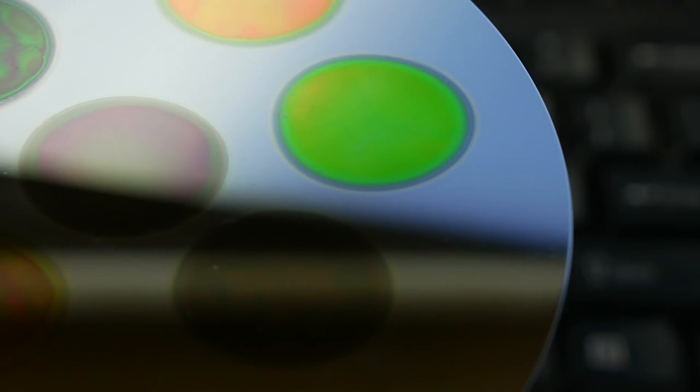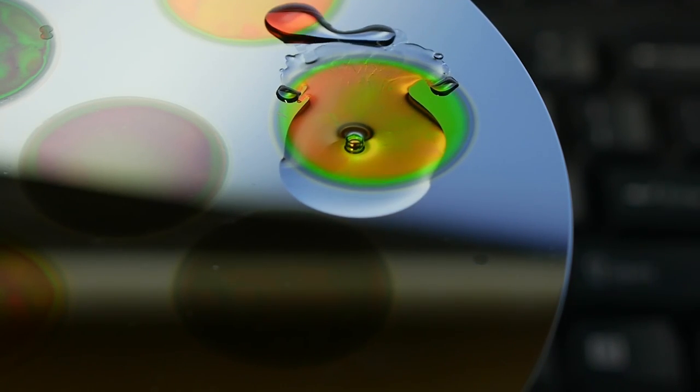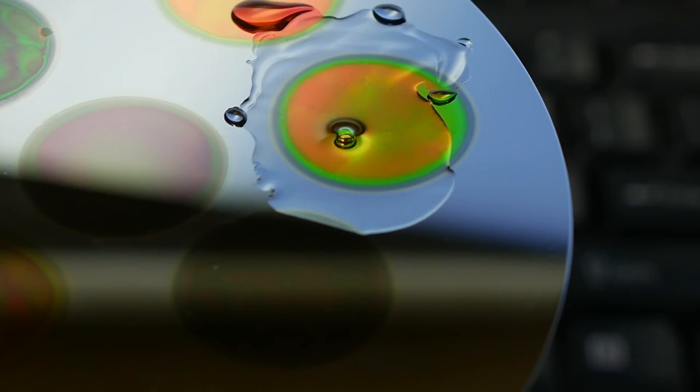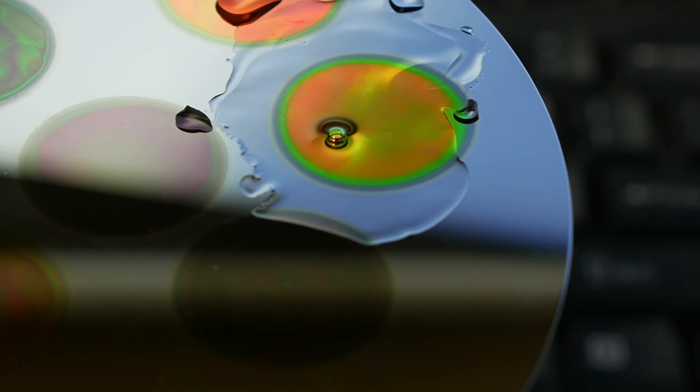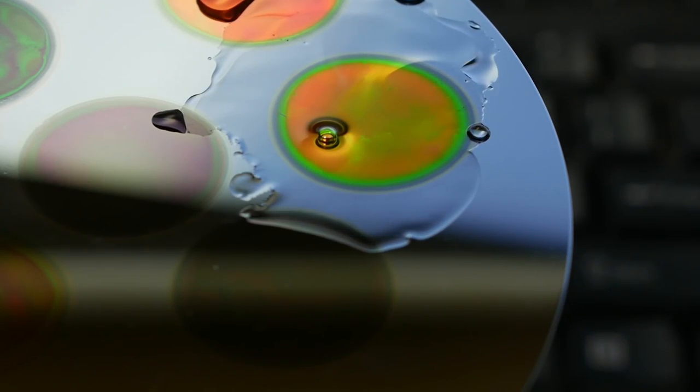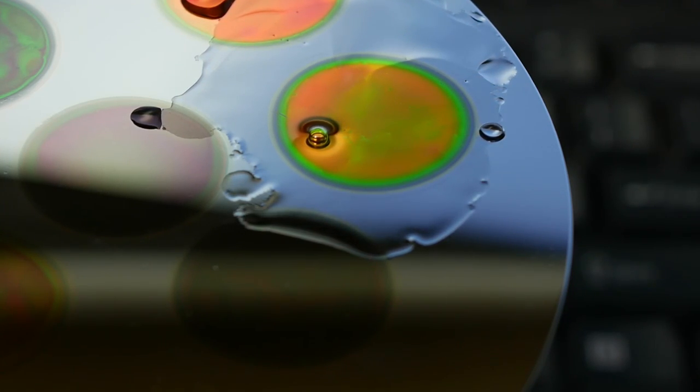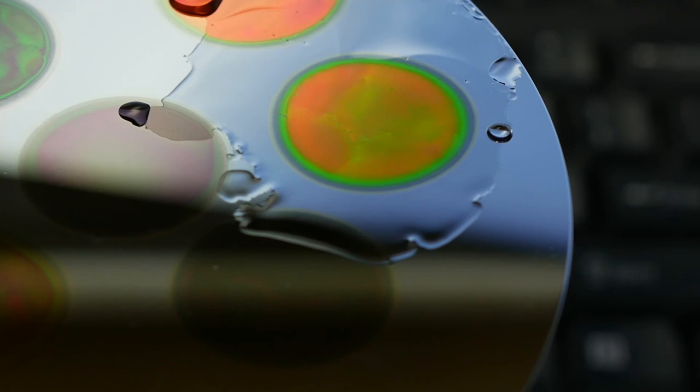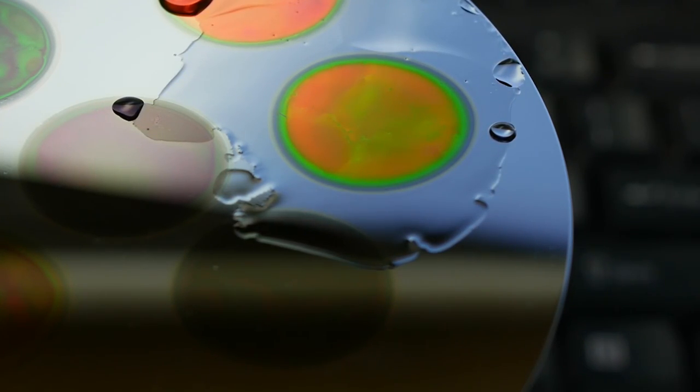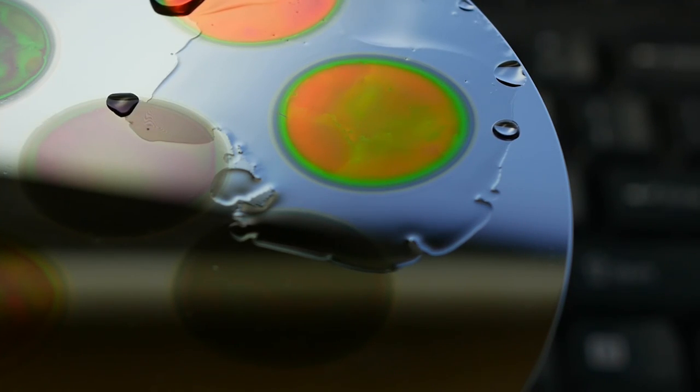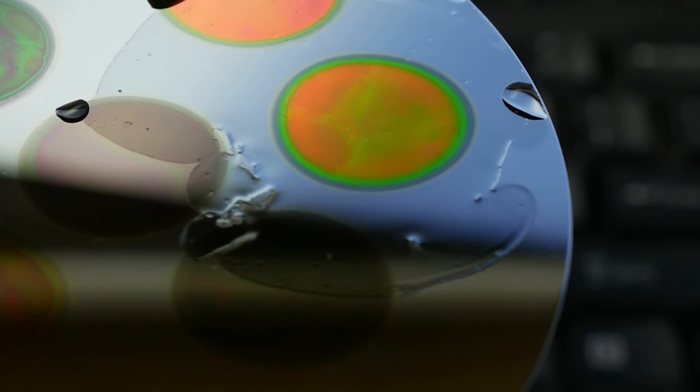So I mentioned the chemical sensitivity of these coatings. So check this out. If we just use a little distilled water and put a droplet on there, not much really happens. But if we put a drop of isopropanol on there, watch this. Pretty dramatic color change. That's so cool. Now, to be fair, I think what's happening here is it's just a surface tension effect where the alcohol is able to soak into the filter and change its optical properties because it is porous. Whereas the water is hydrophobic, I mean, the surface is hydrophobic. And so the water doesn't actually soak down into the pores and thus it can't change the filter. But it does mean that if you coat the filter with something functional, when something does attach to the surface, it will change optical properties. And you can use it as a sensor. As it happens, this particular filter is the only one I've made that has such a strong sensitivity towards alcohol being put on it in terms of color change. So I actually don't know exactly why some are sensitive and some aren't. Open question.